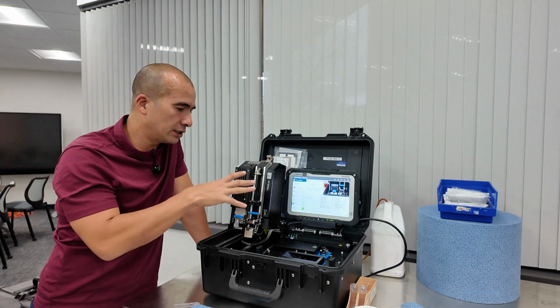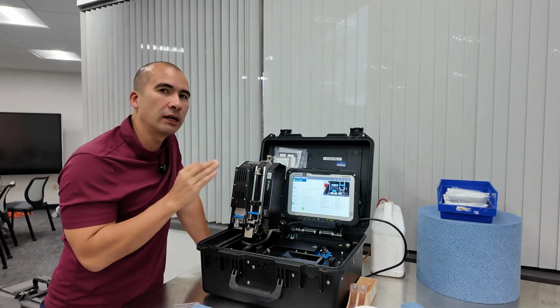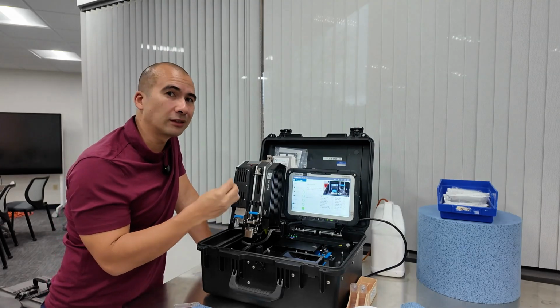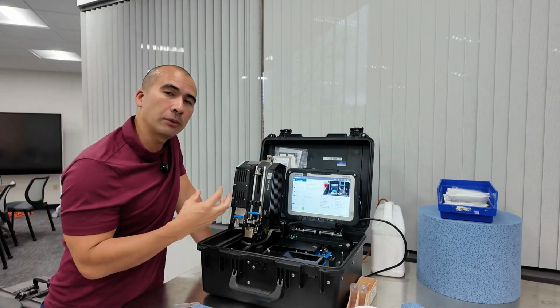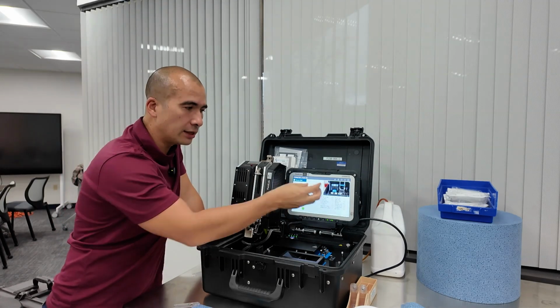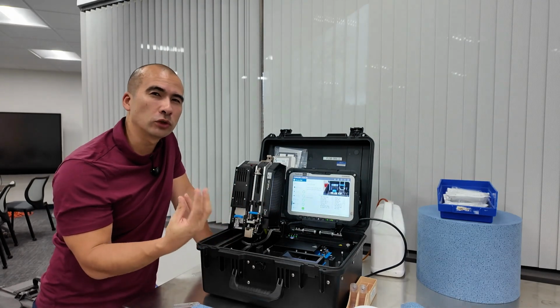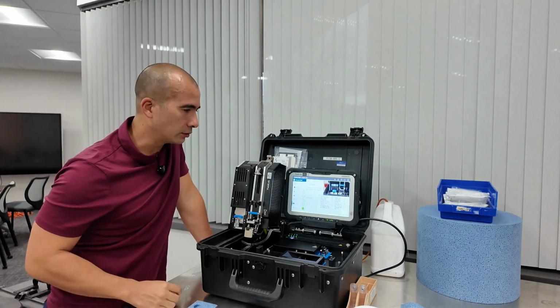So I think this is extremely useful in a number of different applications where you want to identify the specific kind of wear metal. Now keep in mind, this is not elemental analysis the way we do it in ICP, where we're identifying soluble things like additives and other soluble contaminants. So let's say, for example, if I were in an engine oil application and I see copper in this result, I can be confident that it's actual bearing wear as opposed to leaching of the copper coolers, which would be actually a soluble form. Because if it's soluble, it won't be captured by the filter patch.